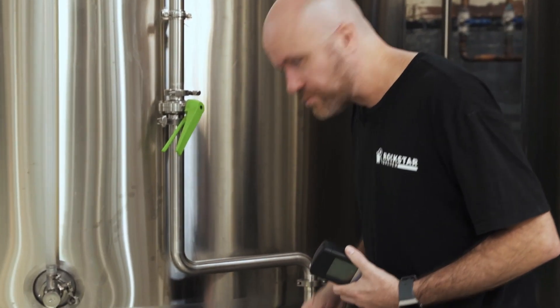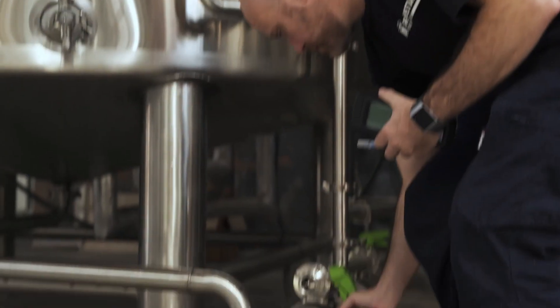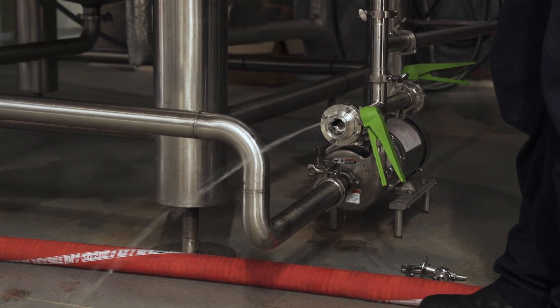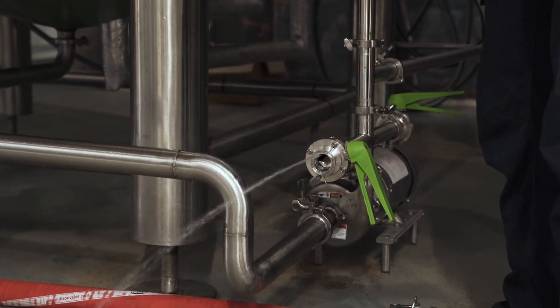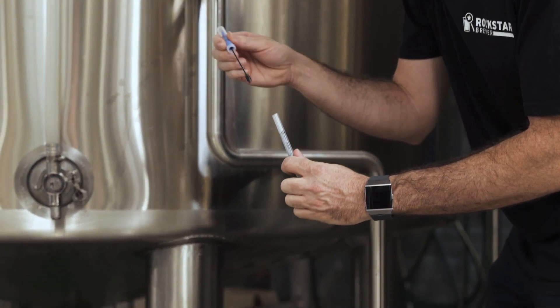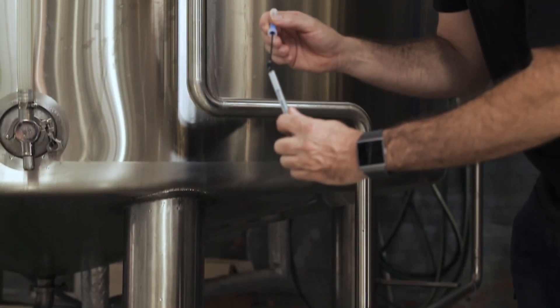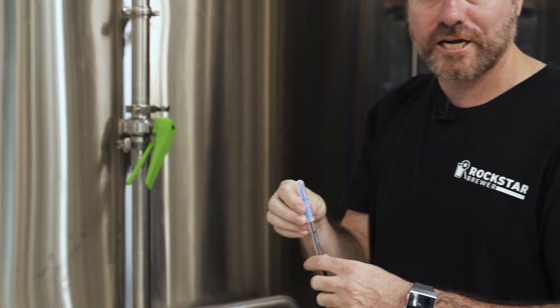What we're going to do here is check the cold liquor tank — not that you'd normally check one, but today we're going to check if there's any ATP inside it. I've got my sample point here where I'll get some water out of the cold liquor tank. I just need to open the valve there to get a steady flow, then take the top off the swab and quickly dip it into the sample stream.